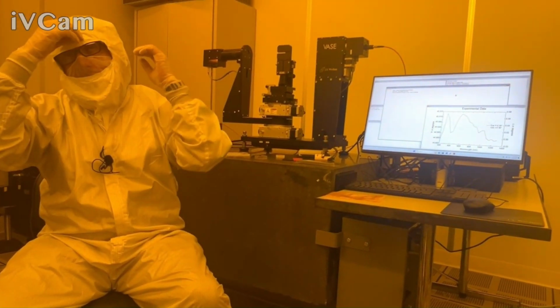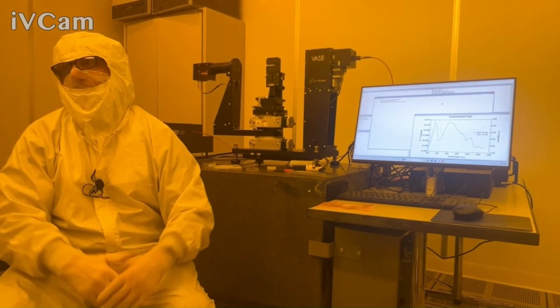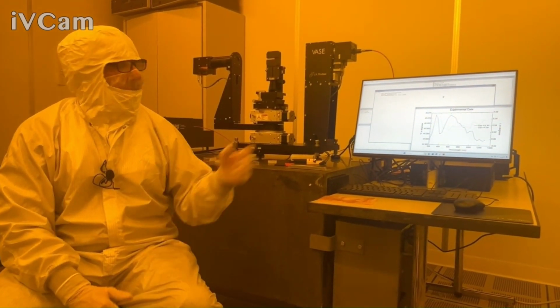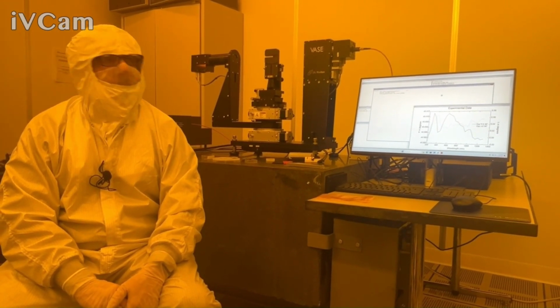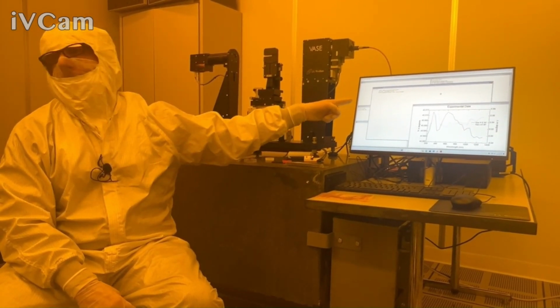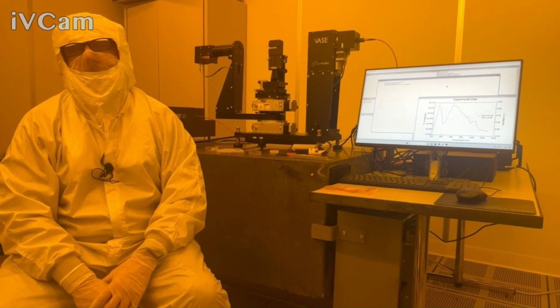But if you're really doing 5-10 minute scans, and you're probably doing several wavelengths, I'm pretty sure that means probably no auto retarder, because it takes about 20-30 seconds per wavelength with the auto retarder. Okay. But I'm also doing 100 revs here too, so that's a lot of averaging time compared to the default.